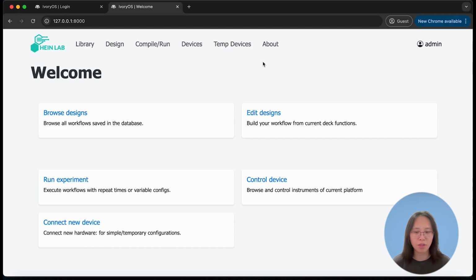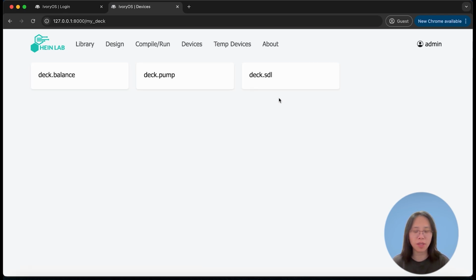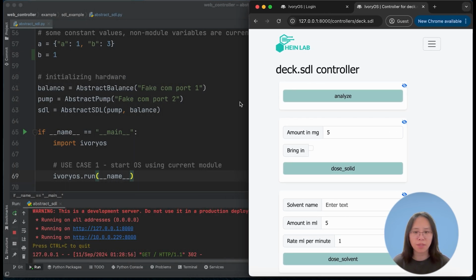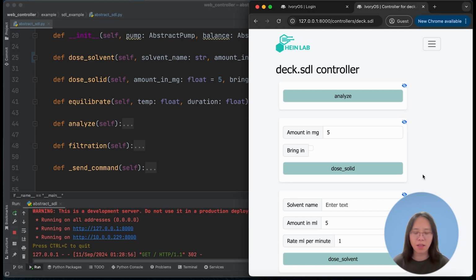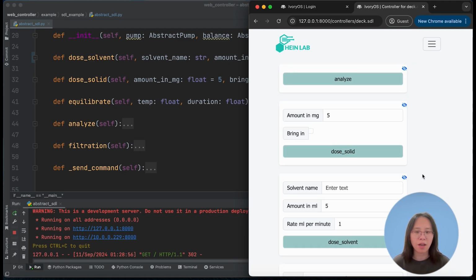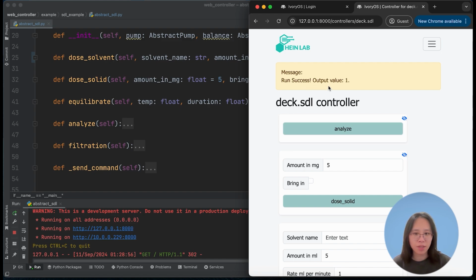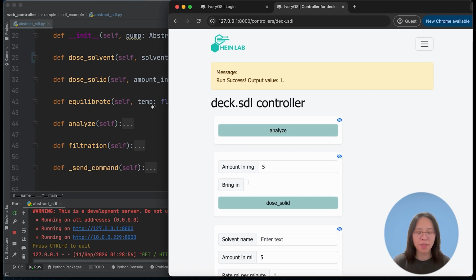There are a couple of options, and those options will also be displayed in the top navigation bar. I will start with the device control interface. On this page, you can see the instances that we have initialized in the Python scripts, balance, pump, and the SDL. I will use the SDL as an example. As you can see, it's a step-by-step comparison to the Python scripts. All of the functions are extracted with the parameter input as an input box. I will simply click the dose solid function, and as you can see, it's pretending it's dosing solid, and it will return the output value over the top message panel.